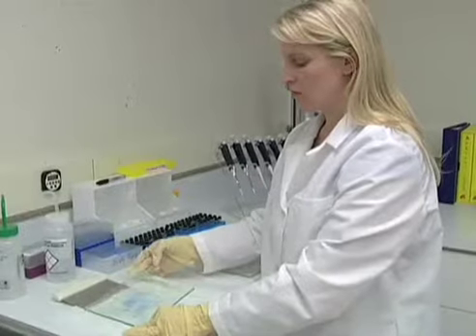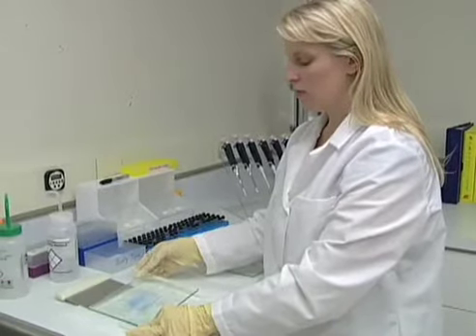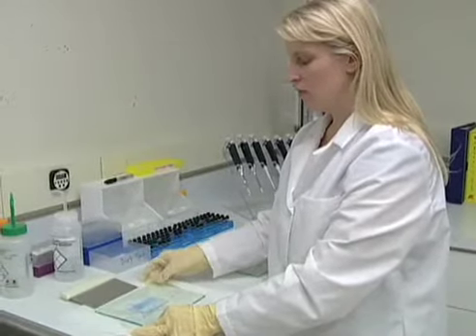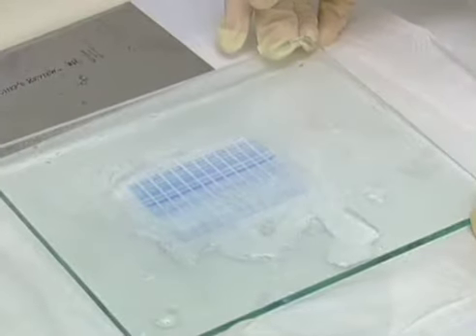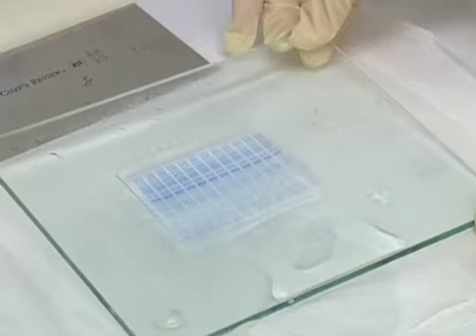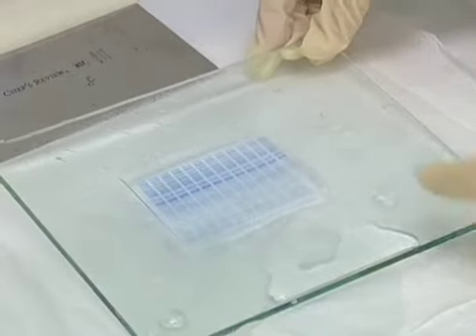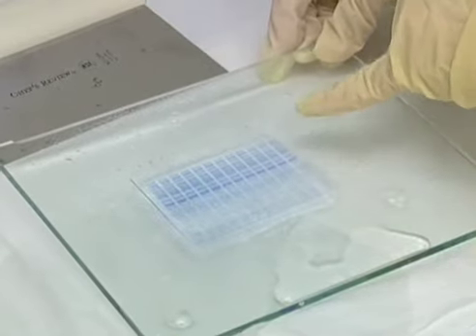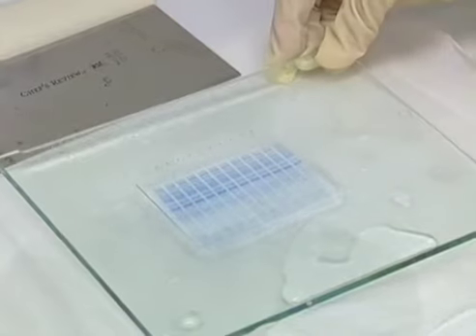After we run the gel, we split it in two vertically, separating the mutant from the wild type proteins. We then cut up the gel horizontally. This divides the gel into a number of fractions with subsets of proteins based on size. The lower regions of the gel contain the smaller proteins, and the higher regions contain the larger proteins.